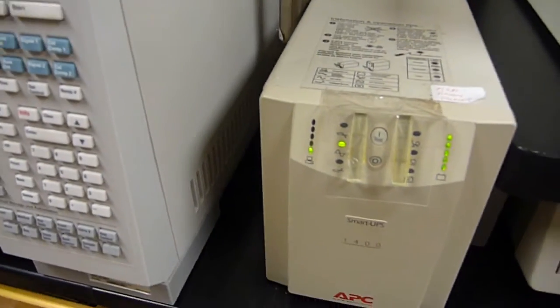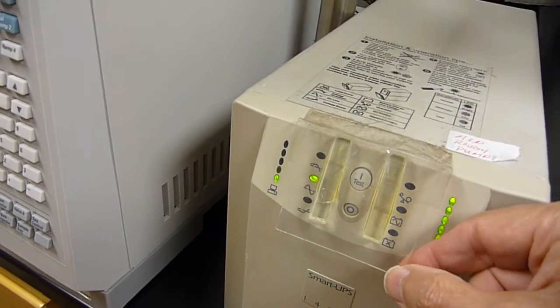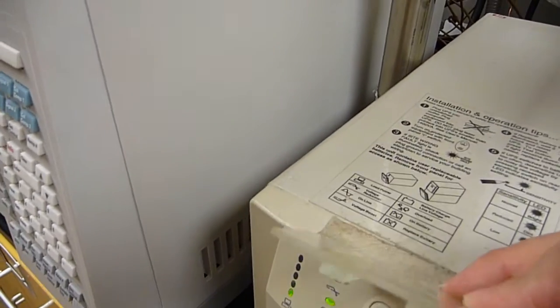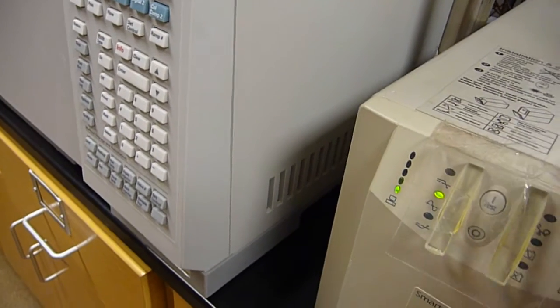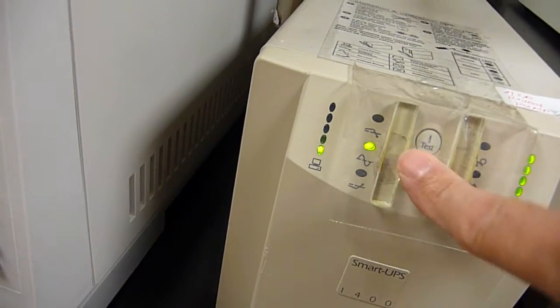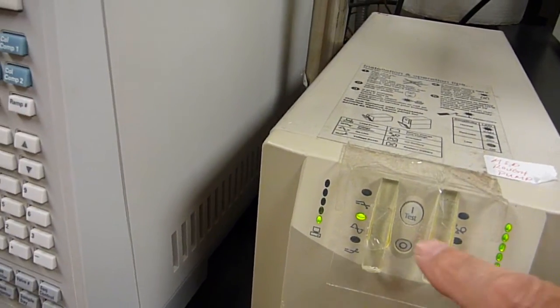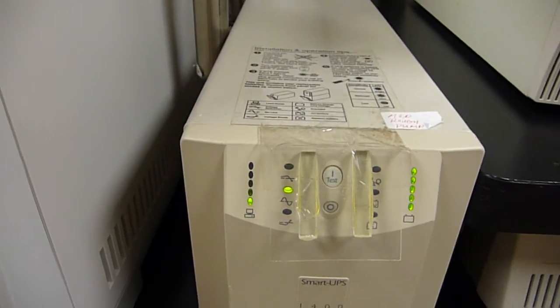If you do go down the road of having UPSs, right, make sure it takes a positive action on somebody's part in order to turn off the UPS. Inadvertent turning off of the UPS is something you don't want. So here we just make covers out of plexiglass with a couple of strips of plexiglass epoxied onto it, and then just use sealing tape. Right? So now if somebody wants to hit that off button, they can't do it. In today's devil-may-care culture, people sometimes will inadvertently hit the off button. This way, it takes a positive action that somebody has to lift and then push. And this way, you can still see the indicators.